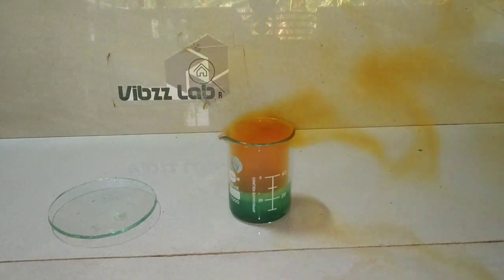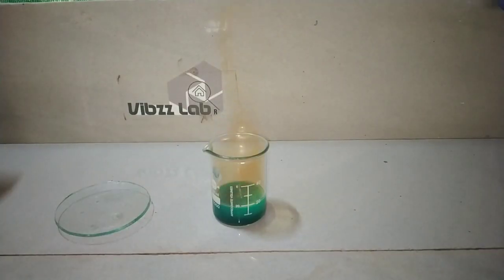Nitrogen dioxide is poisonous so do this outside in a well ventilated area or in a fume hood. This is so similar to how copper would react. This shows exactly how contaminated the silver chain is with the copper metal.